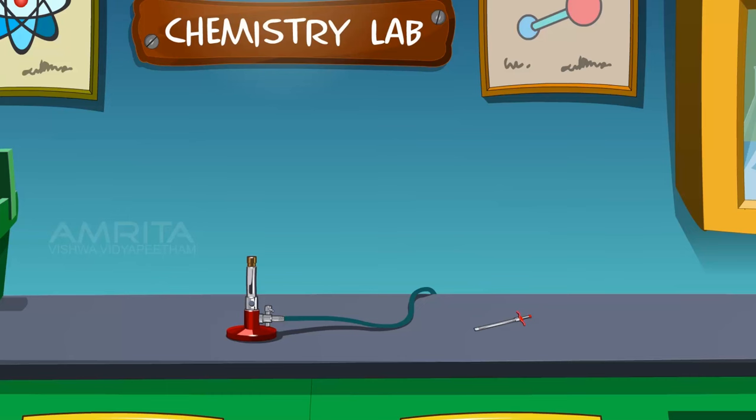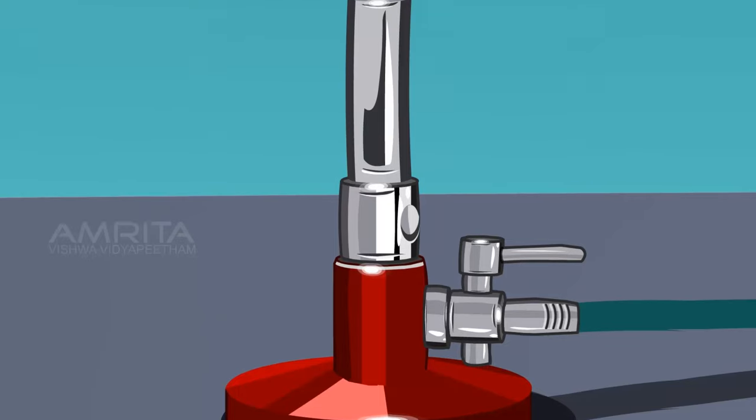We require a Bunsen burner and a spark lighter. Take a spark lighter, turn the gas on and light the burner.